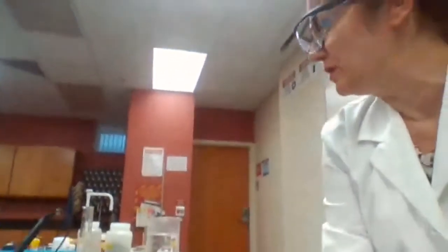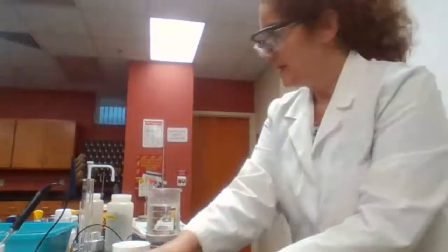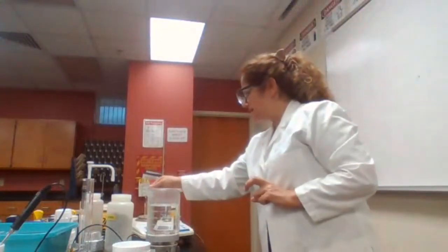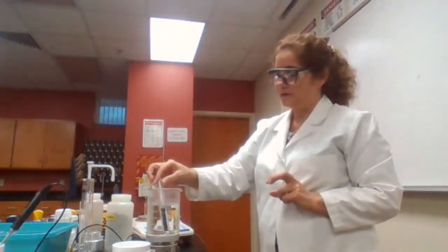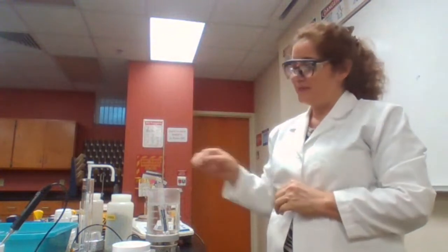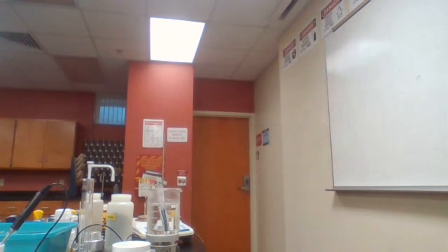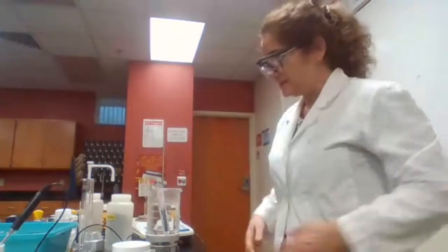We had a choice of two. It was either the zinc or copper. I used the copper for today's experiment. Then we are going to place this test tube inside the hot water for 5 minutes. Gonna time that, leave it there for 5 minutes. And 5 minutes should be enough time for the heat to be transferred to the metal and the metal to get hot. Actually, it reaches a high temperature. So we're going to time for 5 minutes.